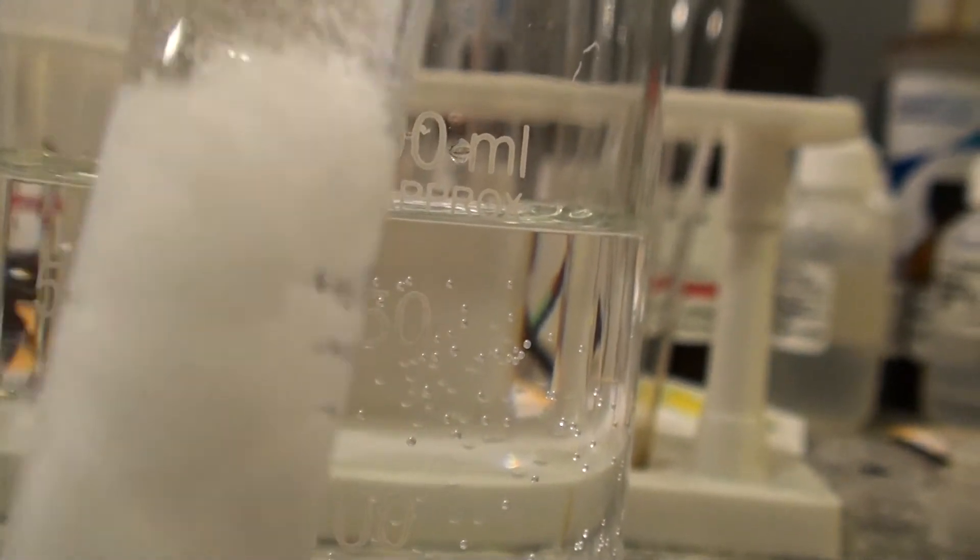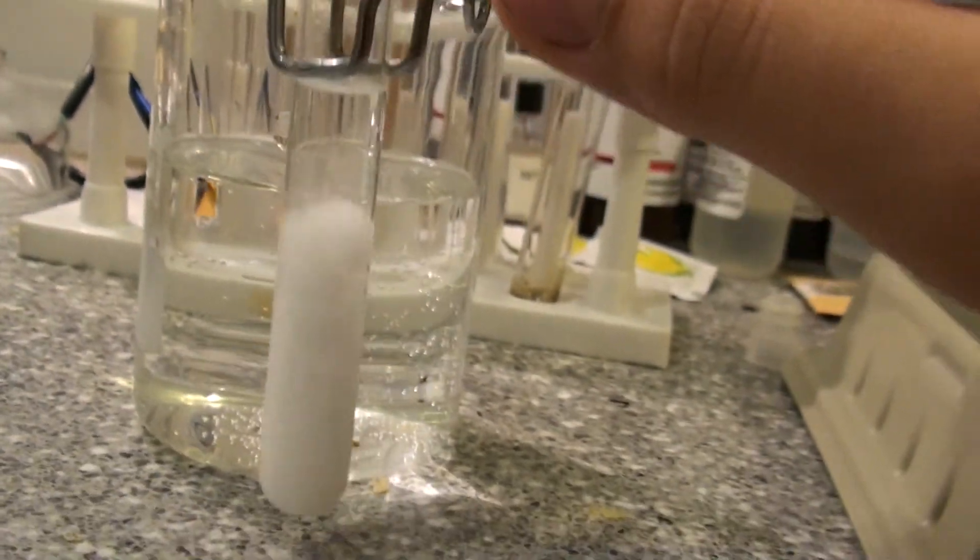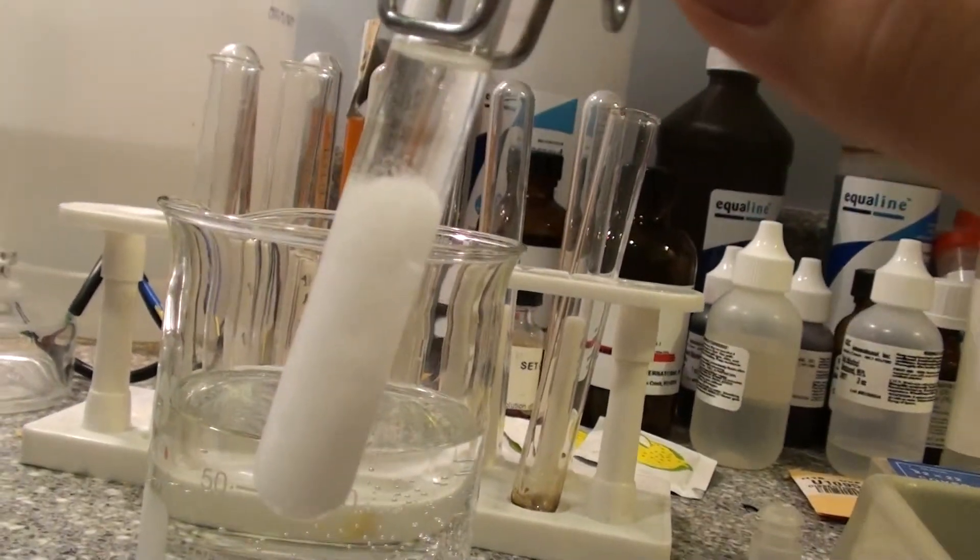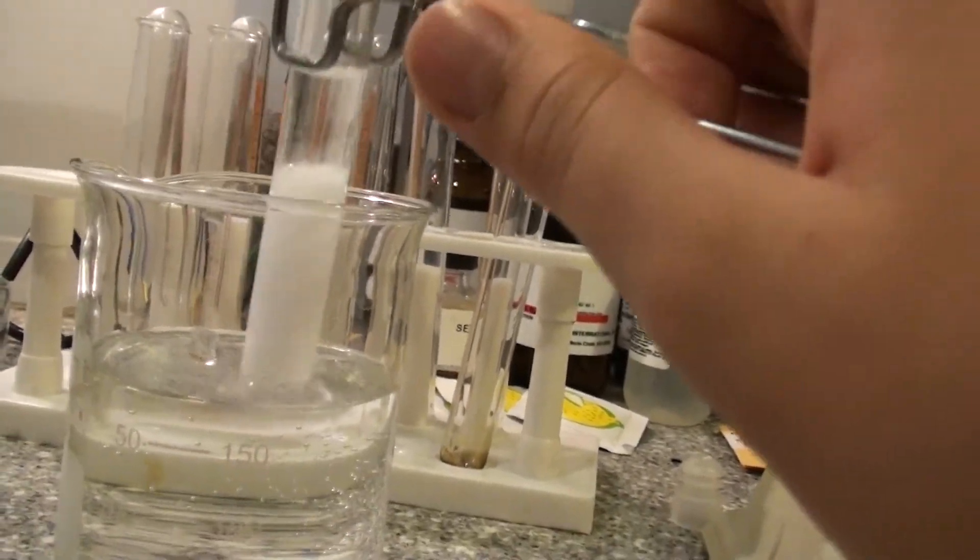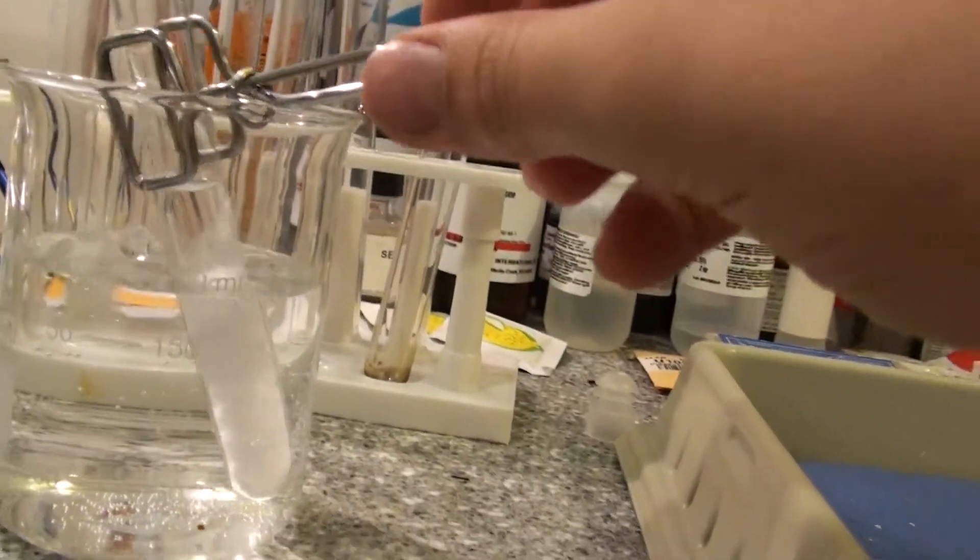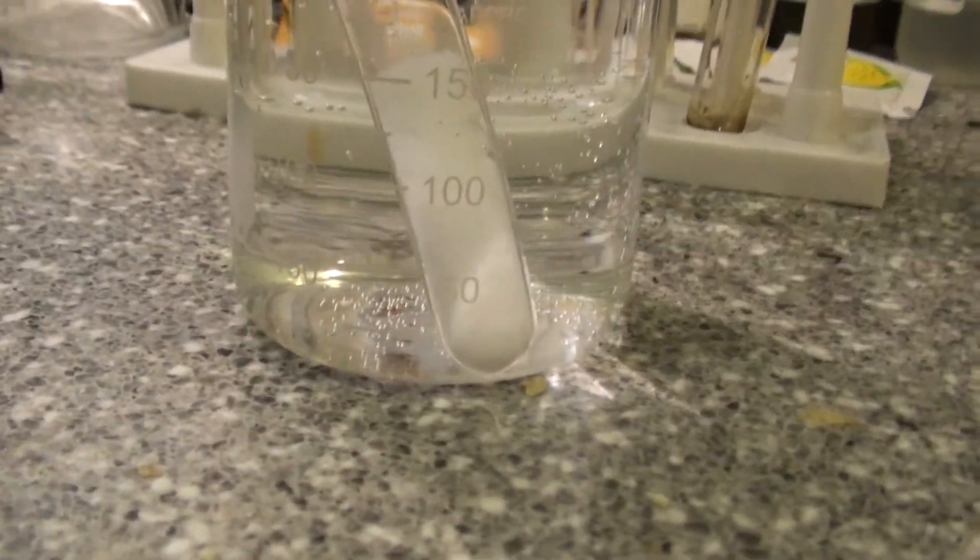So, soon the snow should take over the entire test tube. It's now filled more than halfway up. Put that back in until it recrystallizes. I'll later dissolve that into more water. Make it safe.